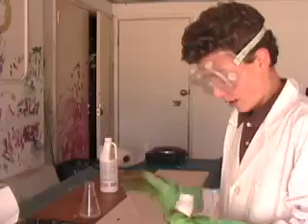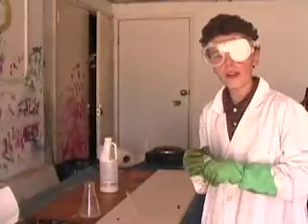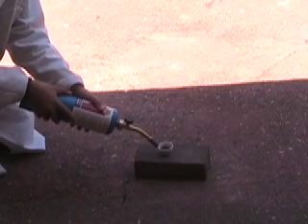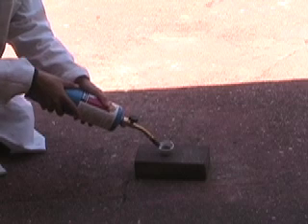I also have magnesium powder — it's not super fine, it's 40 mesh — but it'll still burn pretty nicely. So I'm going to light it on fire with a propane torch. Little flashes, you see, shooting up.